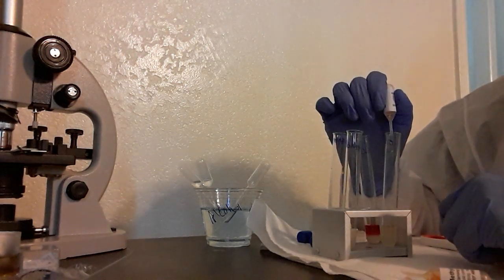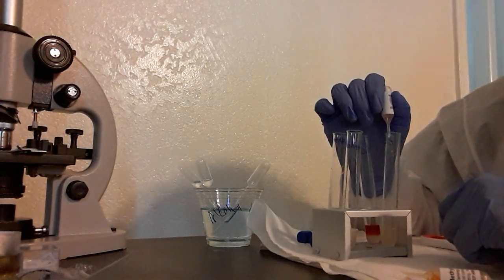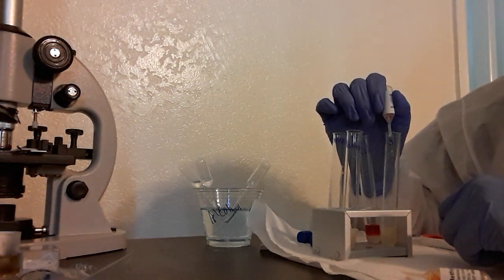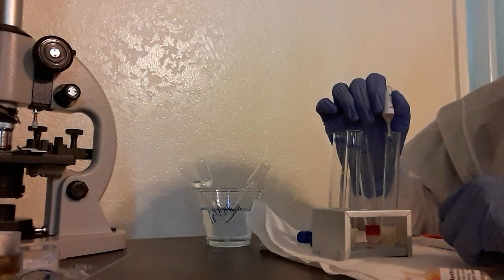Alright, I'm going to do 12 in here. One, two, three, four, five, six, seven, eight, nine, ten, eleven, twelve.